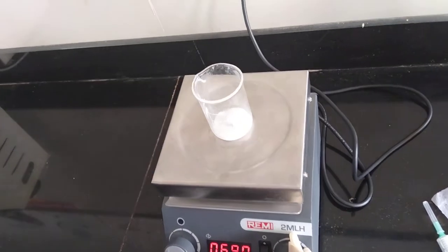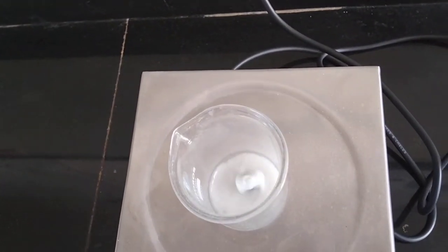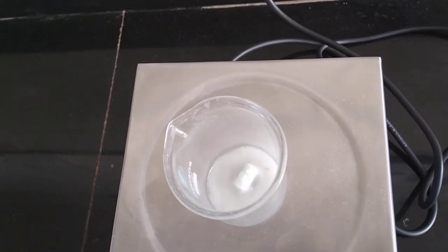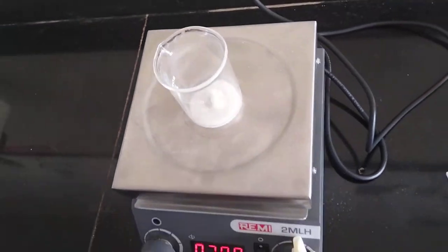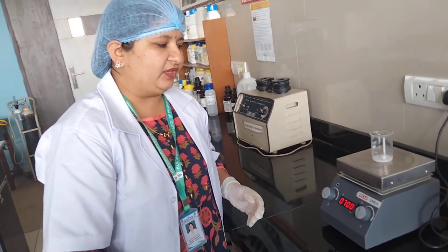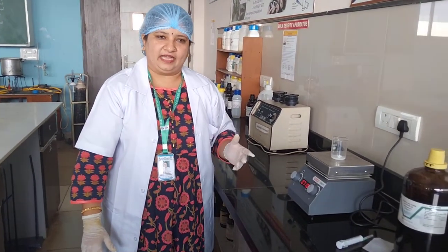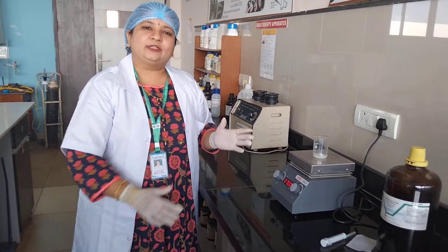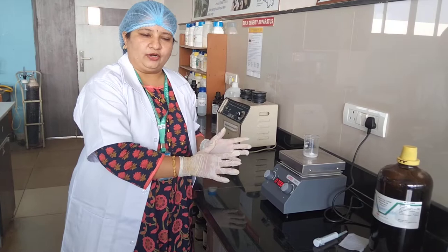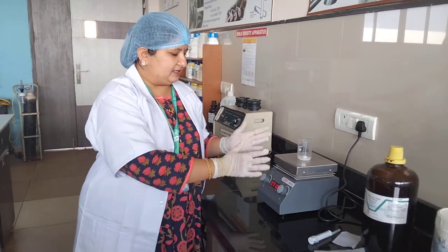Here we can see a homogenized mixture of the two polymers and the drug forming. HPMC and ethyl cellulose will start embedding the drug in the core. The core-to-coat ratio is 1:2, wherein 250 mg of drug is taken along with 500 mg of HPMC and ethyl cellulose. This is Part A of the preparation, where ingredients are dissolved in acetone as the organic solvent.